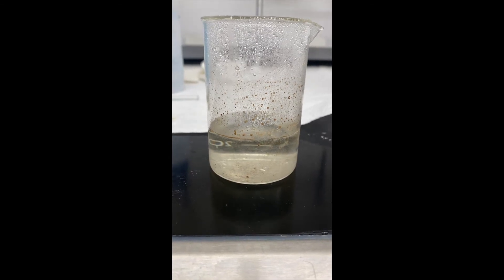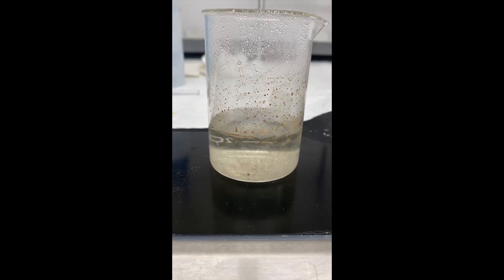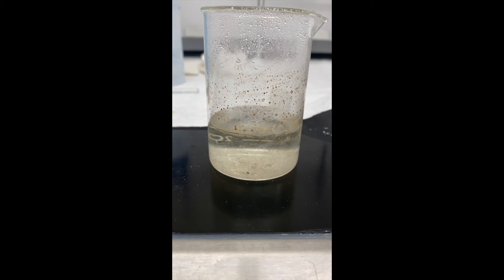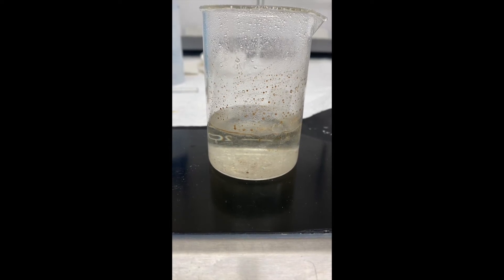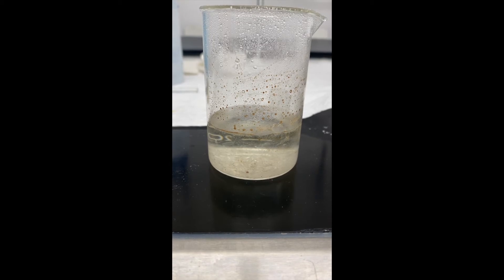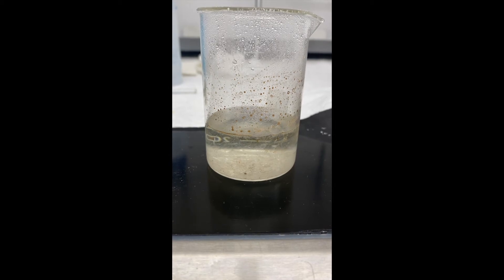So here I've taken the solution off of the hot plate and it's starting to cool. So you can notice that you see little crystals starting to crash out of solution. And the slower this goes, the better you start to form more pure crystals.